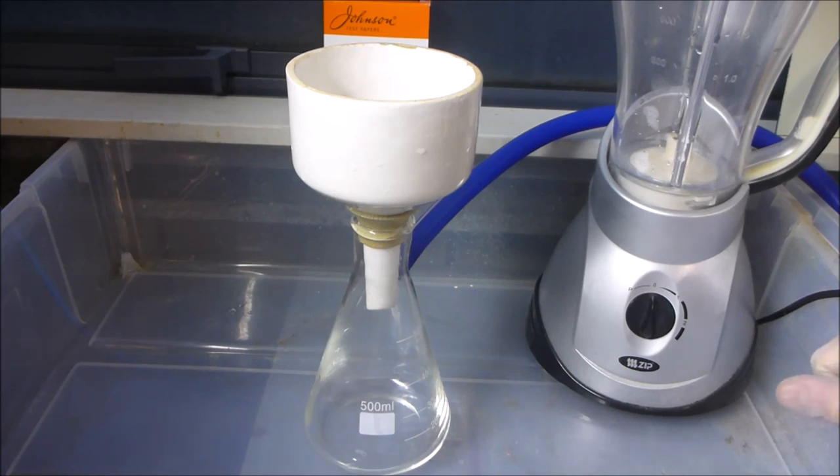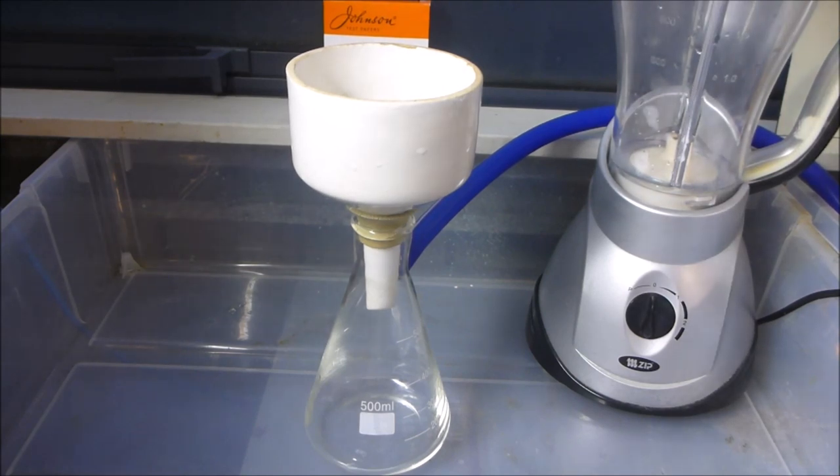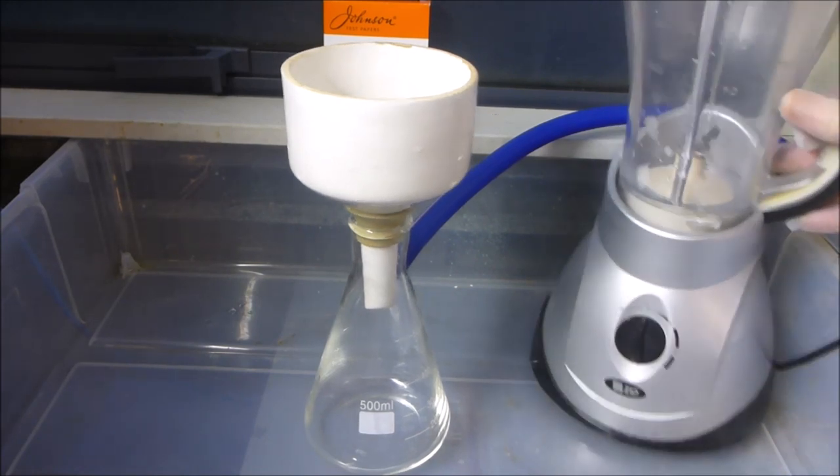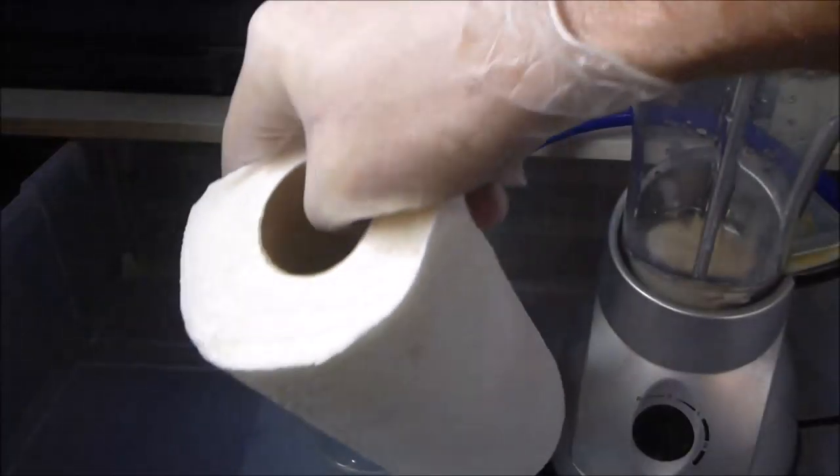There is a method where a lot of chemists use a material called Celite, which they line their filter paper with, and then they filter through that as well as the filter paper, and that does a relatively similar thing. But I found with the type of solutions that I use, Celite doesn't work very well. You end up with a gelatinous mess. And so I've come up with my own hillbilly version that does a similar thing. So we've got our blender here, and we've got a roll of paper towels.